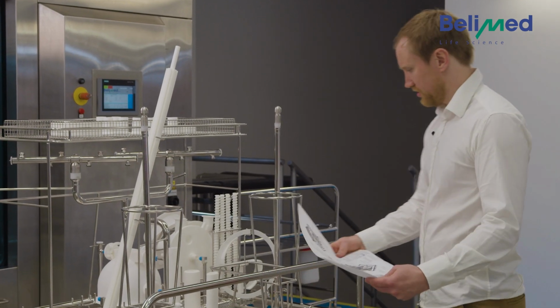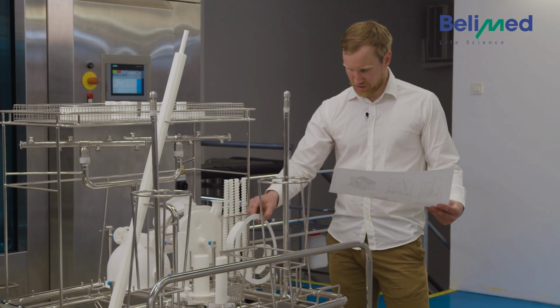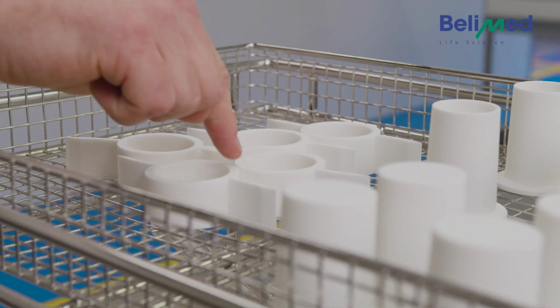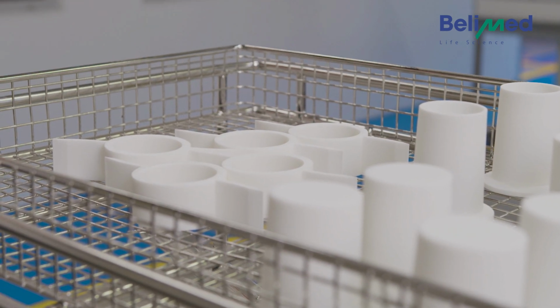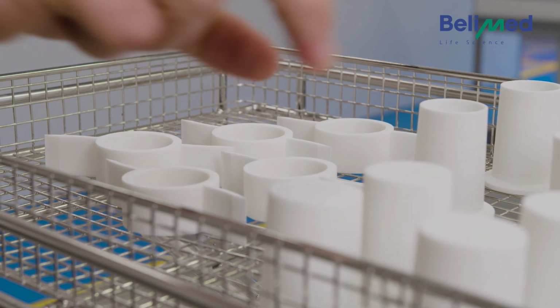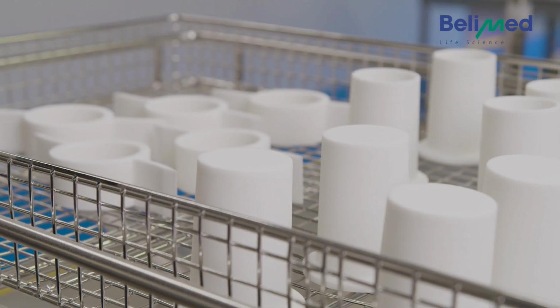So let's see if I did everything correctly. So these parts are all good. This part here as well. So the first problem I can see is up here. These parts touch each other, and where they touch each other, it's not possible to get them clean because no cleaning detergent can reach these points. So it's necessary to pull them a little bit aside so the water and the cleaning detergent have a chance to clean it. You can't see that on the loading scheme. That's just knowledge you need to have or you need to get taught.